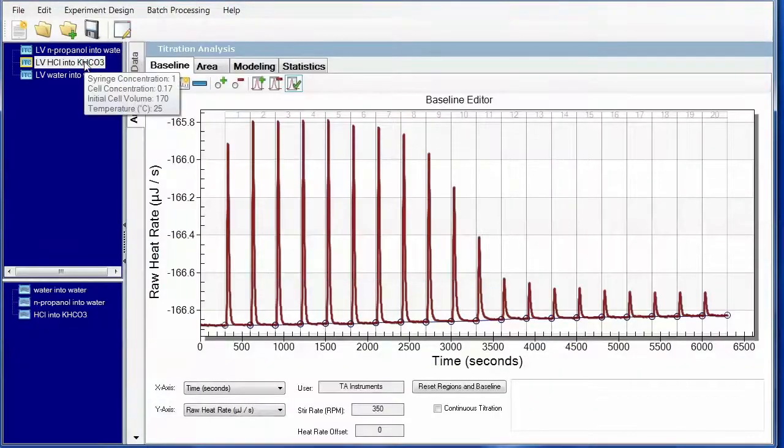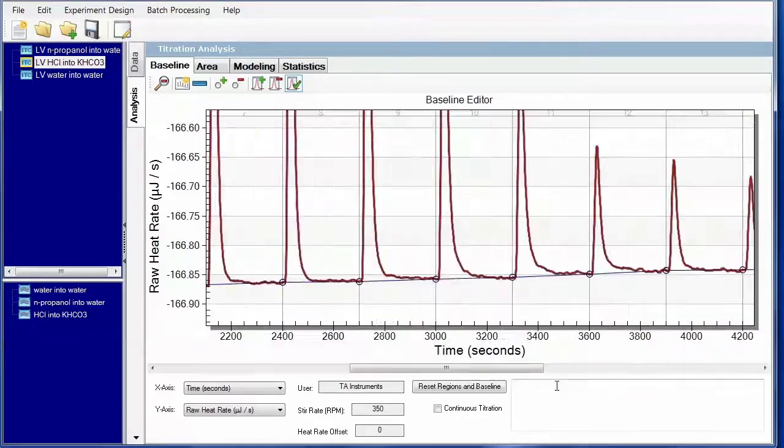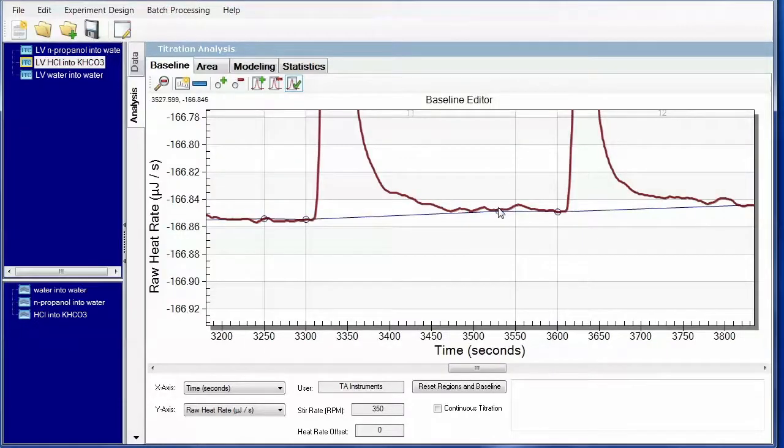The last experiment in the validation kit is the acid into base, or the HCl and bicarbonate. So once again, we're going to look at the baseline, zooming in instead at a particular area, in this case through the inflection region, where we get a little bit more tailing on those peaks. So we could leave it as is, but we will bring this in a little bit, and we're going to zoom in on just this one peak to make sure that we've done an okay job with the baseline. And that looks fine. Undo zoom.